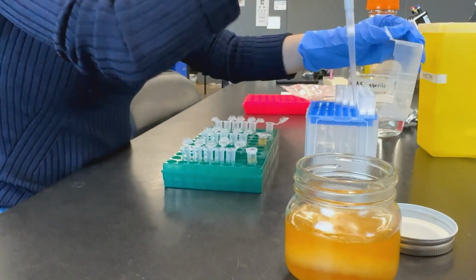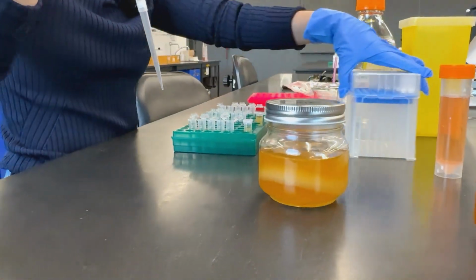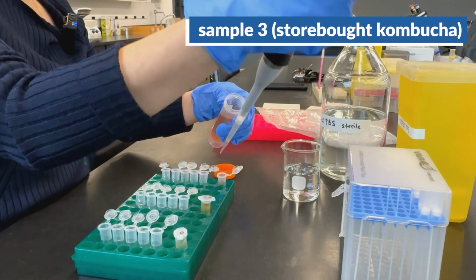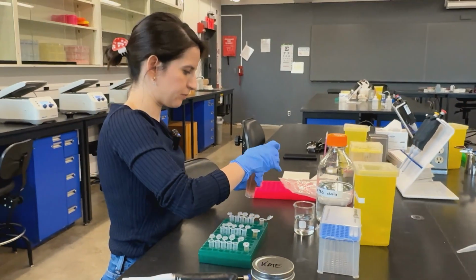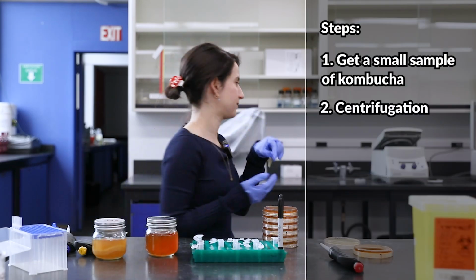So I'm switching tips between each of these different kombucha because I don't want to cross-contaminate between them. So the next step is to take our sample to the centrifuge.